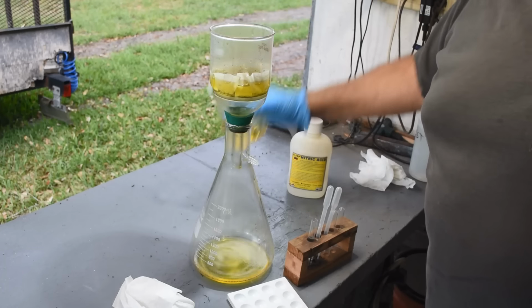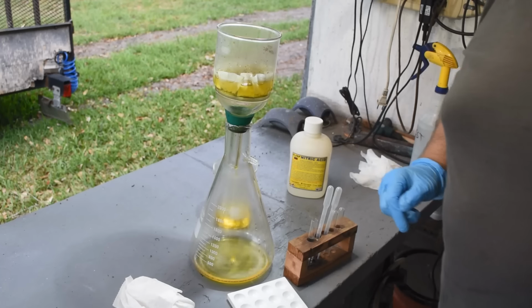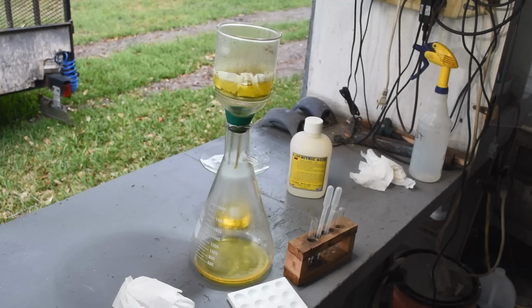And keep that up until it's all through, and then run it through a second time. Third time if necessary, but I'll bet before I'm even done with the second time, all that gold will be dissolved. Not my first rodeo with the iodine leach. I know what I'm expecting here. So, okay. It's going to take a little while since we're doing this solely by gravity. We'll be back when it's done.